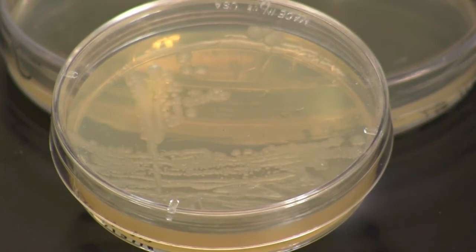Invert the plate and place it in an incubator at 37 degrees Celsius for 24 to 48 hours.